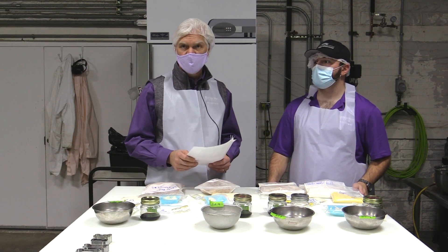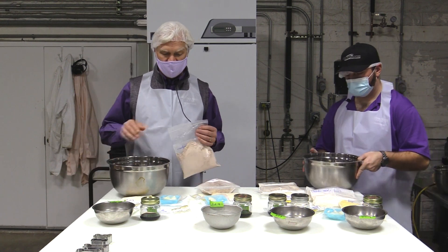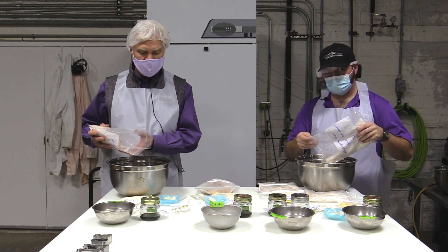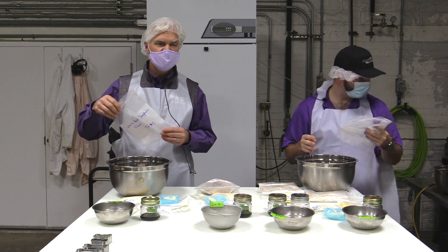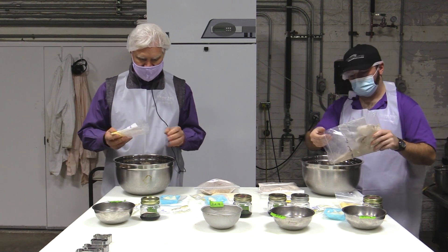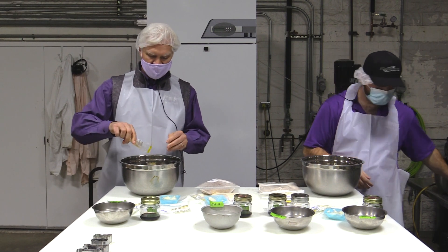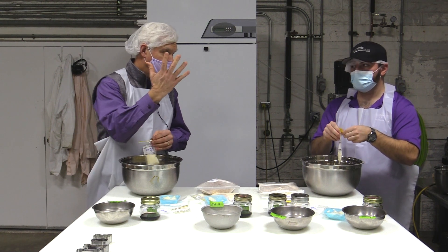Now we start to assemble the mix by taking all dry ingredients and incorporating them into the mixing bowl. In an industrial facility we'd use a large ribbon-type or sigmoid-type mixer. During mixing, water is added at the end, and as the dough hydrates it becomes very dense — you have to have just the right kind of mixer because there's a lot of tension in the dough. Here, instead of a Hobart planetary mixer or ribbon-based mixer, we're going to use the old-fashioned method — our hands.